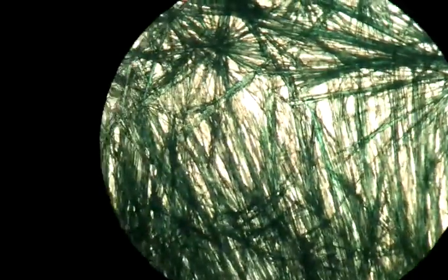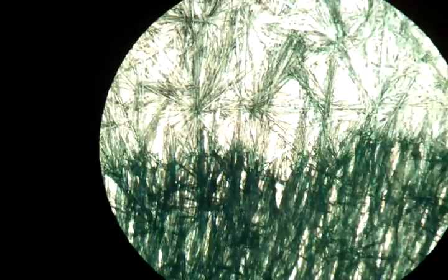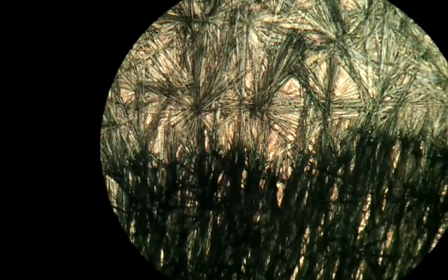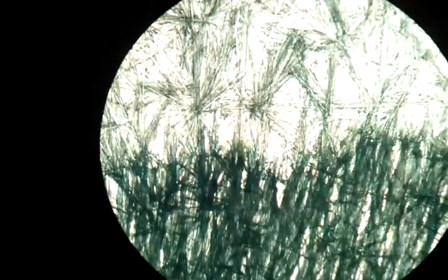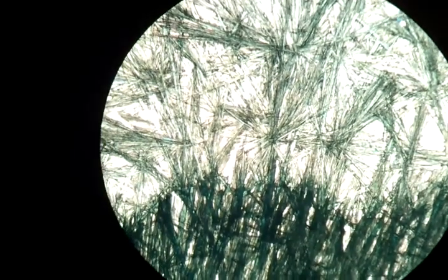Now turning all around. I'm just going to turn on the light to see how it looks. The edge here is much more cut. And we're back to the area where we started.